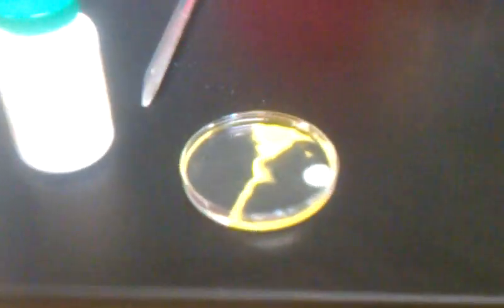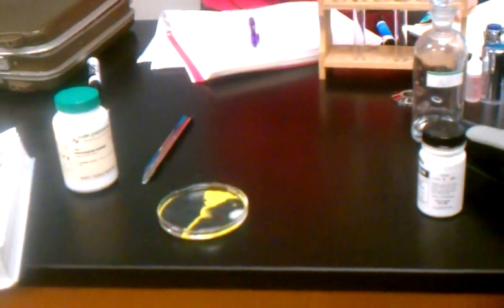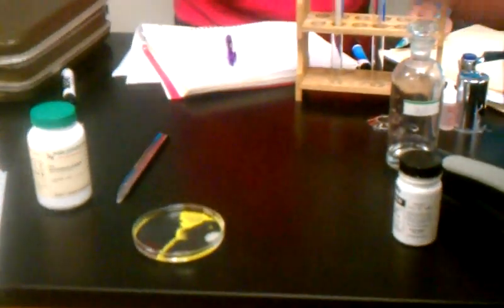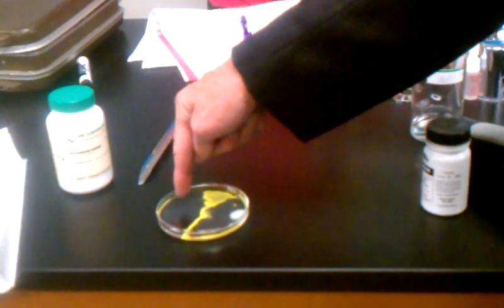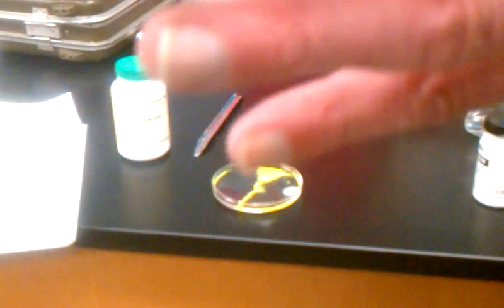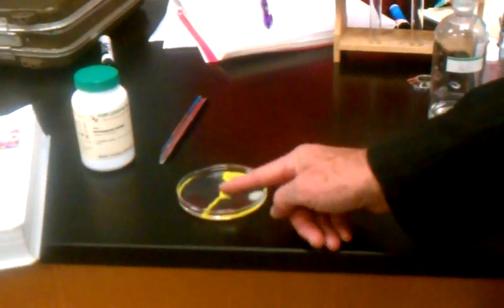Did everybody get a picture of this? Because I'm about to disturb it. We don't want to use this as eye shadow because you would be a shadow walking amongst the dead. That is a precipitate and it is the lead iodide. Now there is in the solution the other ions — the potassium nitrate is in there. And if I wanted to separate them, I would have to filter them. It's the lead iodide that's yellow. The other ones are totally colorless.